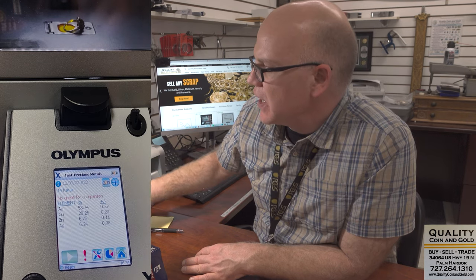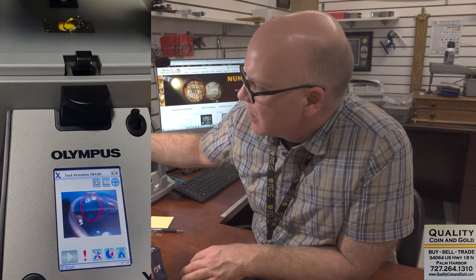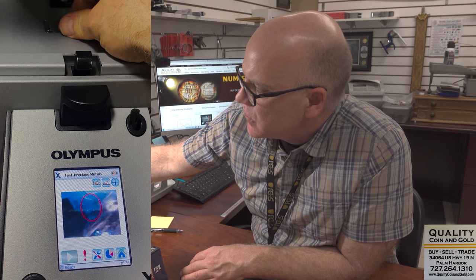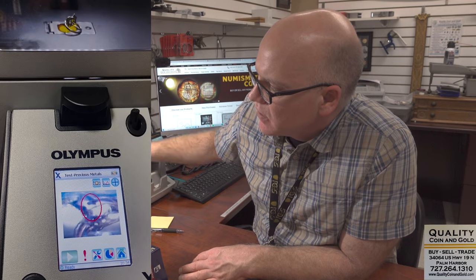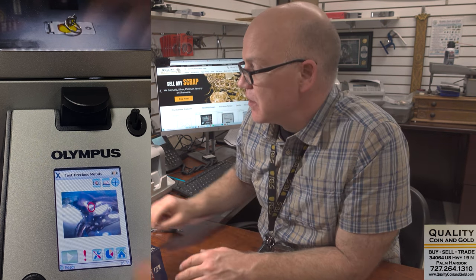Here's the ring that's stamped palladium — let's see how that works. I'm going to adjust so you can see. That'll give us a nice spot to take a sample of. Basically, whatever is in the picture is what's being sampled — whatever's in the red circle. If we want to pinpoint a smaller area, we can take a pinpoint sample, but the smaller sample is not as accurate. So we'll try a pinpoint sample and then a larger sample and compare the results.